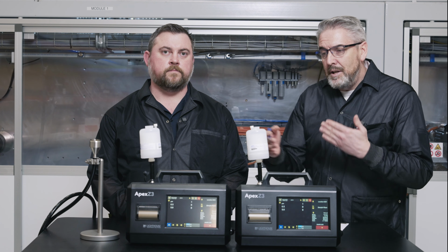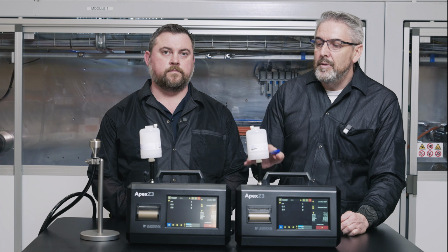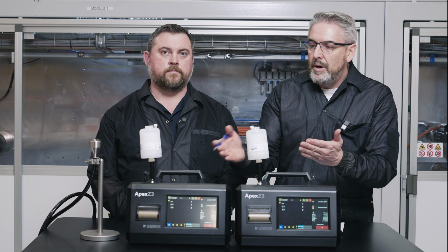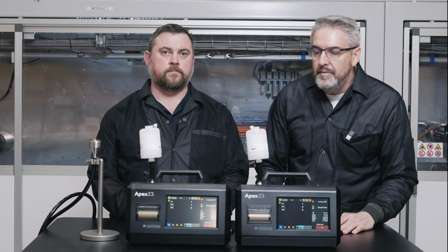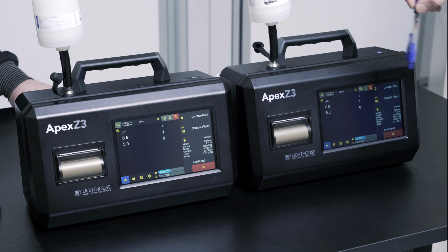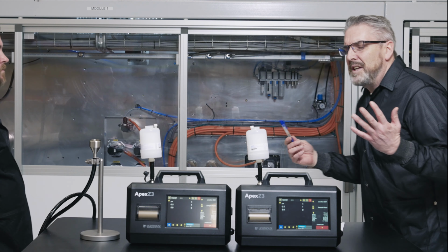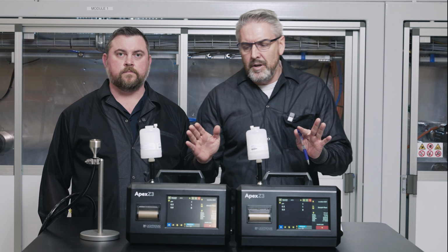So today we're setting up the testing. We're going to do test method 1, but before we jump into test method 1, we're going to zero count the particle counters to verify that we're getting zero readings in the sensor. So as we can see, we've got a couple of counts here. This will clean up over time a little bit. And generally, like 10 minutes with the zero filters on, you're good to go.